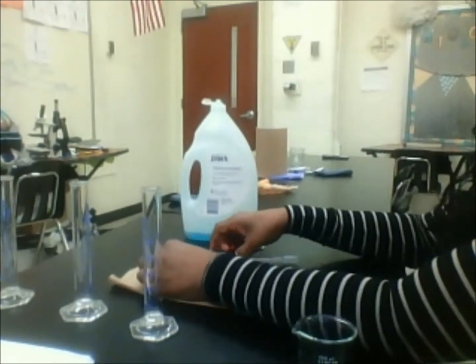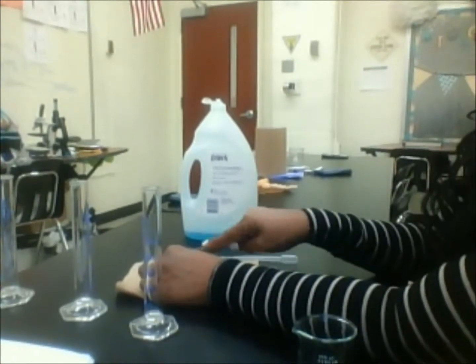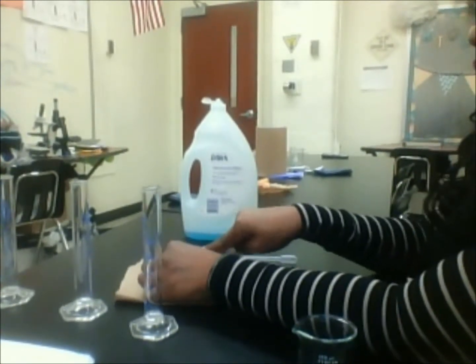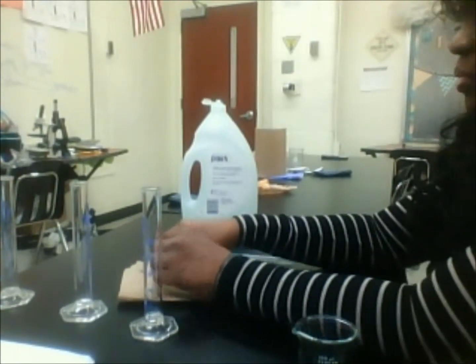And then cube 3, I'm going to cut in quarters. Lord knows I need some lotion. I just finished washing my hands to get this potato stuff off my hands and put lotion on.